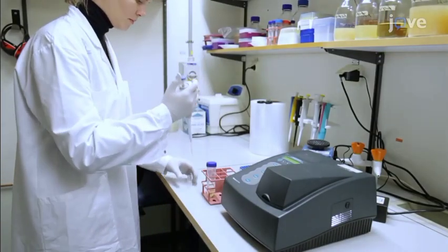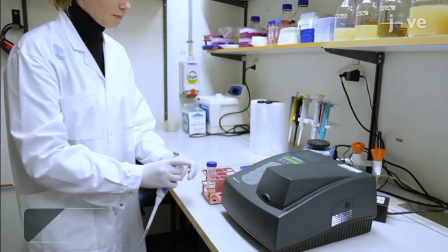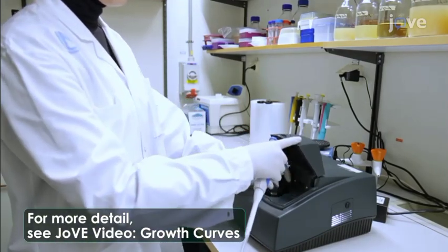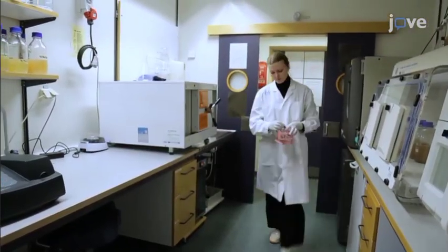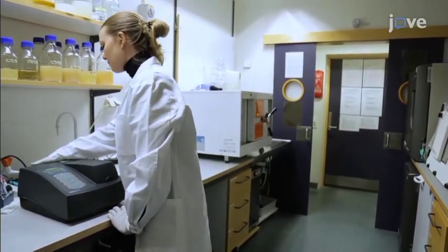Next, use a spectrophotometer to check when this culture reaches log phase growth, indicated by an optical density of 0.5 to 0.7. Once the OD reaches this level, stop the incubation by transferring the cell culture to the bench. They are now ready to be used for phage overlay assay.